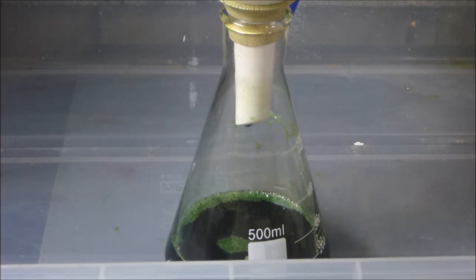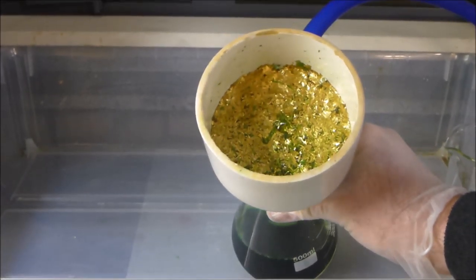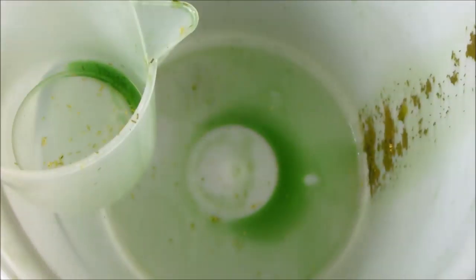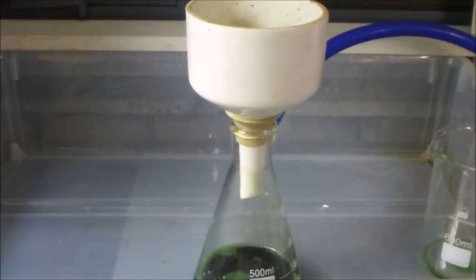So if I come out a bit here, it's not quite done yet, but you can see there we're looking pretty good at the top, and down here we've only got a little bit of gold left on the side of the bucket that needs to be washed out now. But yeah, this is absolutely incredible.